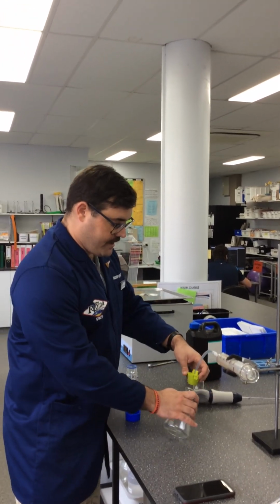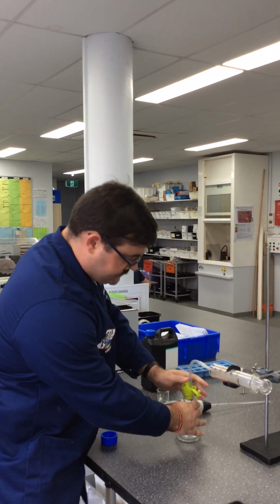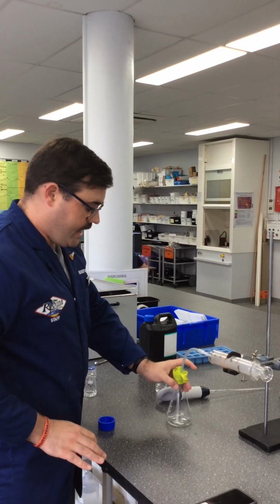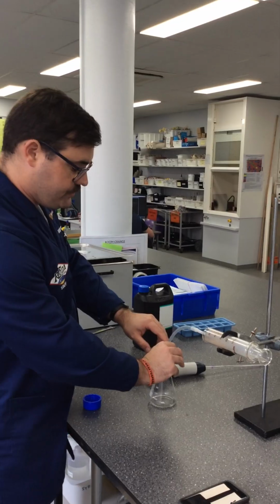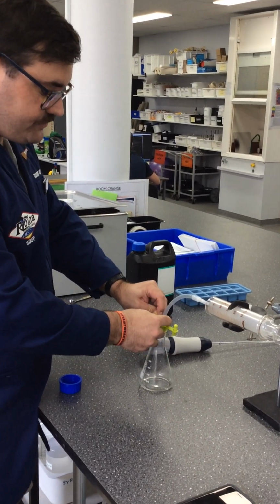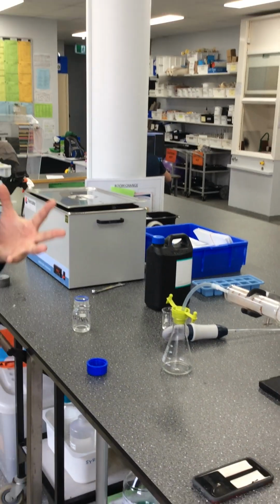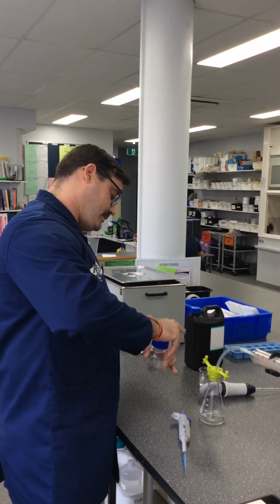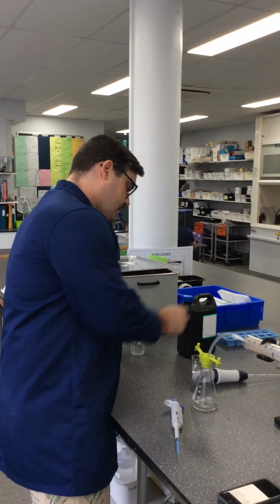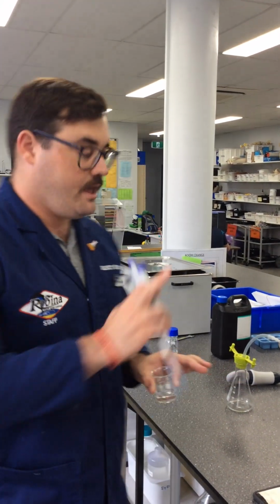Okay, we're going to pop our bung in the top here. Press it down nice and tight. We don't want any gases to escape. And you'll notice that we've actually got 2 holes here. One has our hose in it at the moment. The other one we're going to use for inserting our Catalase so that we can basically minimize the amount of gas that's lost. Make sure we put the lid back on that. Good lab behavior.